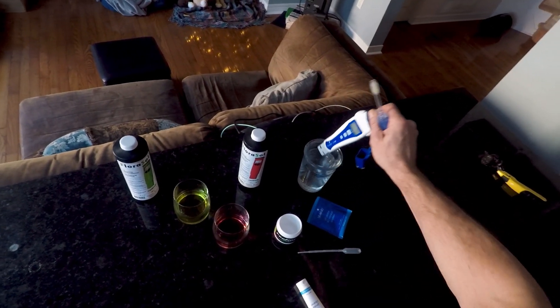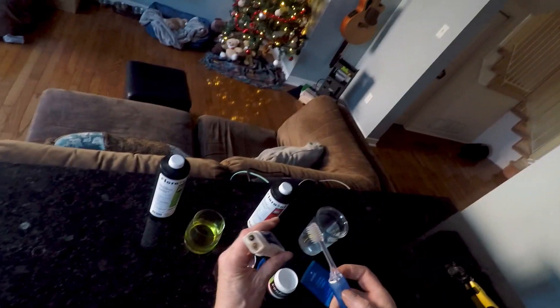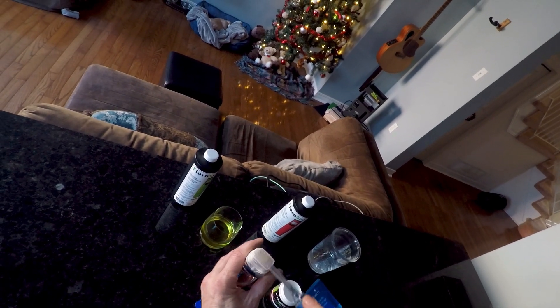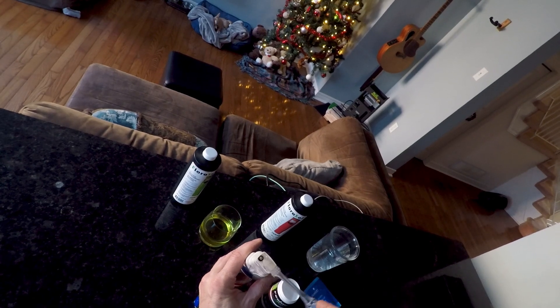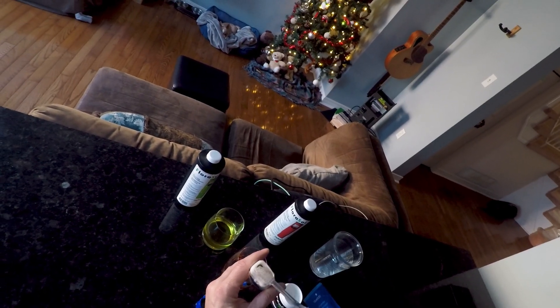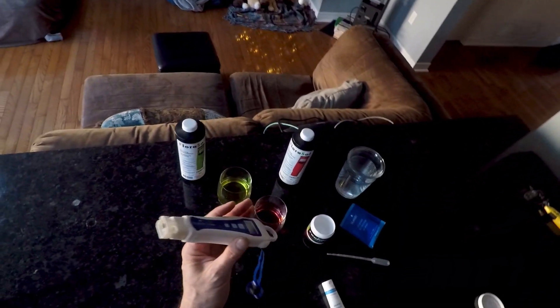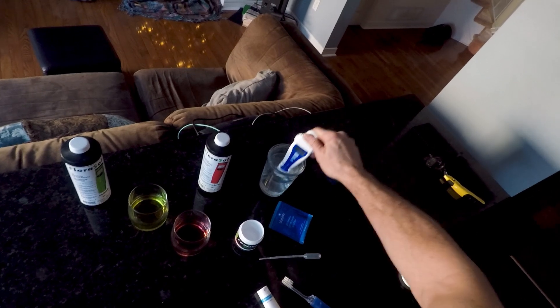Give that a little rinse — try not to bang it around like I just did. So you want to give that a little clean with your cool little toothbrush. Obviously I don't need to be pressing too hard or anything. A little swaddle around there. Beautiful.